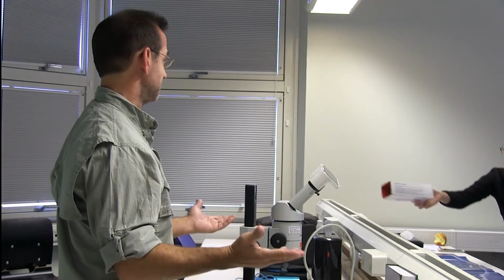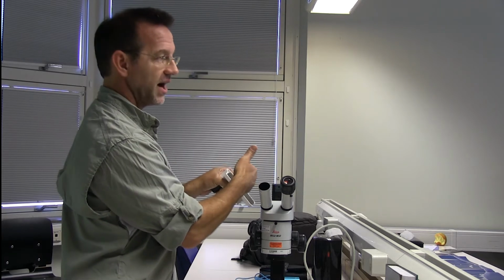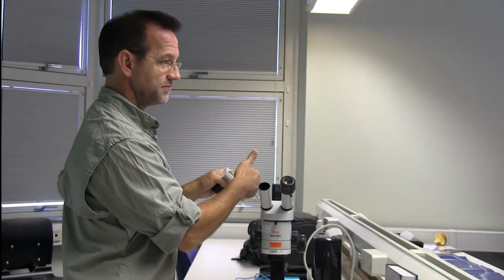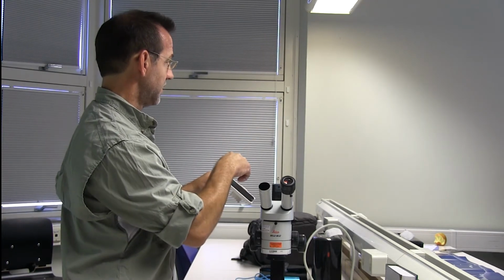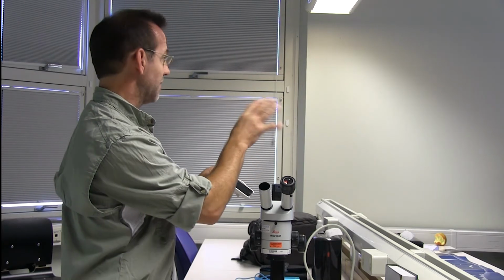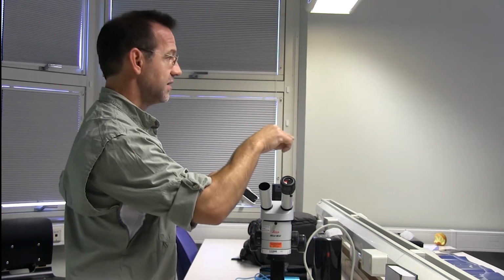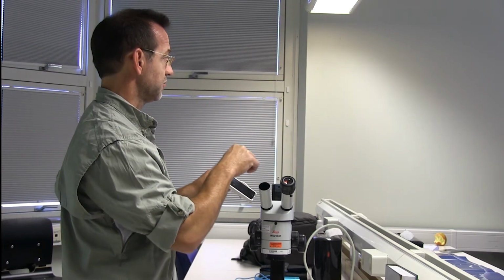So very simple one. But here's my recommendation. For example, the iPhone or Android camera is not as good as some of the camera apps that you can download. And so I typically use another camera app that's more adaptable, where you can change the lighting, or you can go to manual focus, because that's really important.